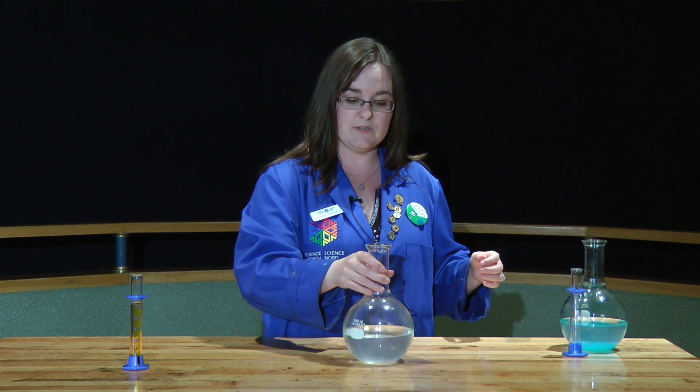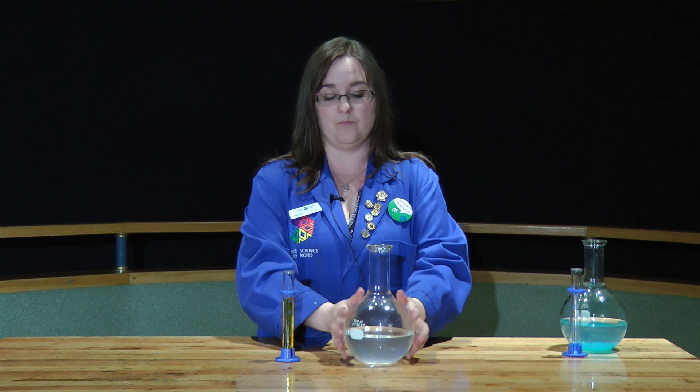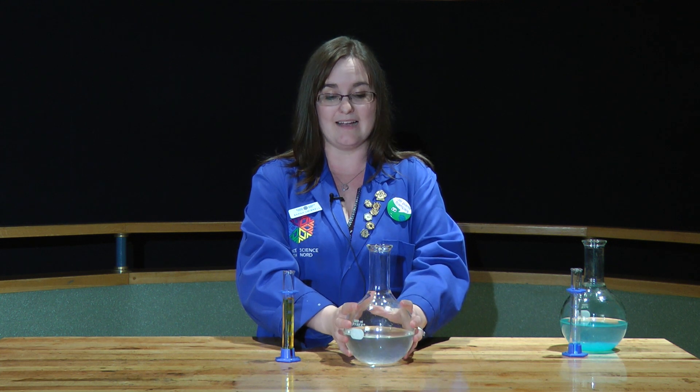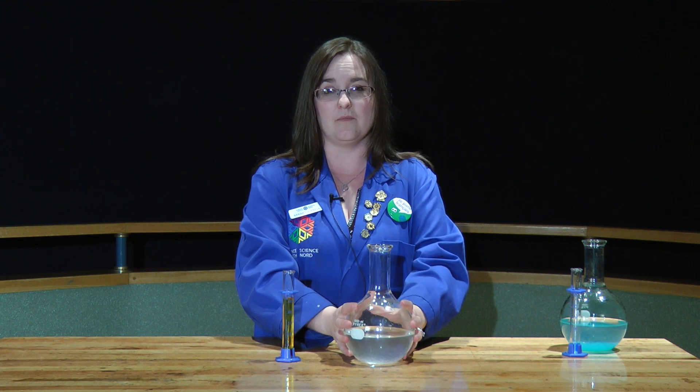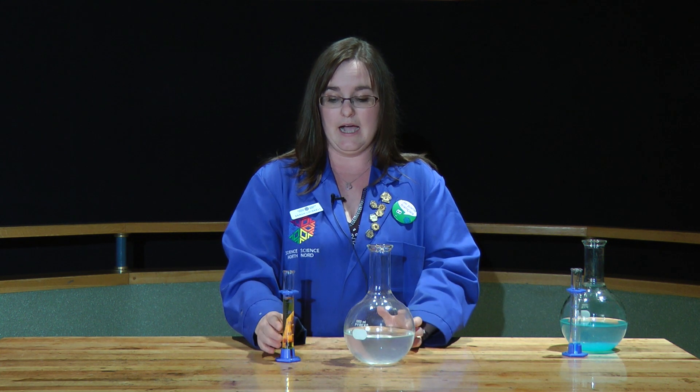Okay, so now there's not only one of these reactions, there are many different types. And I'm just going to do a second one here for you now. We're going to start off with the same initial reactant in the round bottom flasks — this is sodium carbonate. But instead of copper, we're going to use iron sulfate.